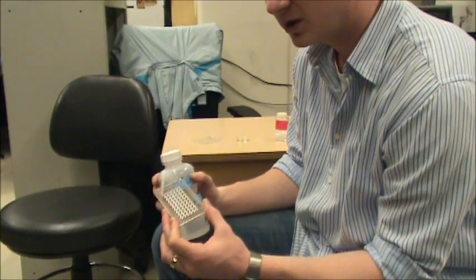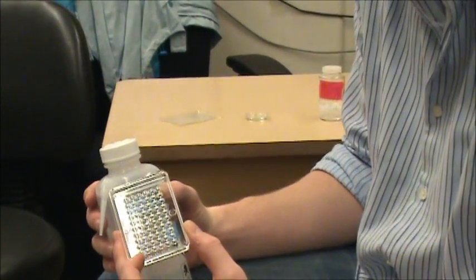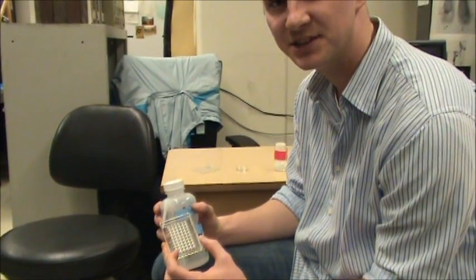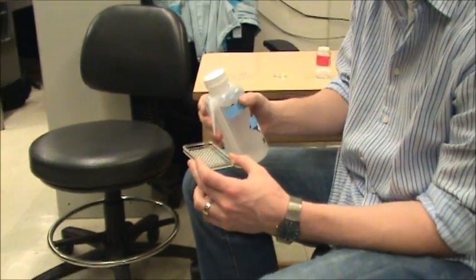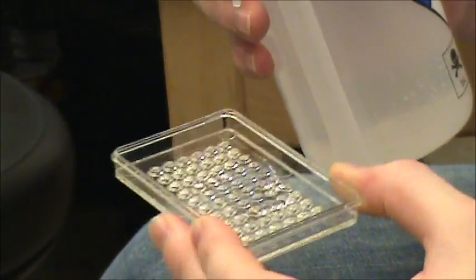Also we could have something like polylysine or con A in the bottom of the dish to make the neurons stick better. We'd want to do that before the fetal calf serum so the calf serum proteins don't stick to the bottom and inhibit the adhesion of our cells. Anyway, we'll just use the leech saline and we'll put it into the dish. We shake it around because it'll develop these bubbles down in the wells and we want it to be just saline.